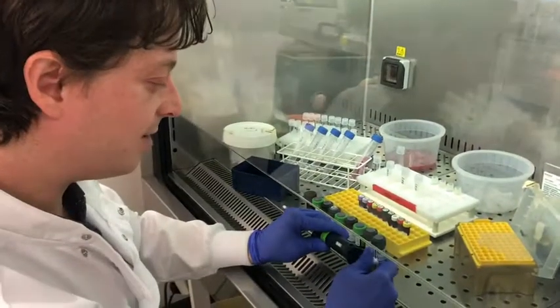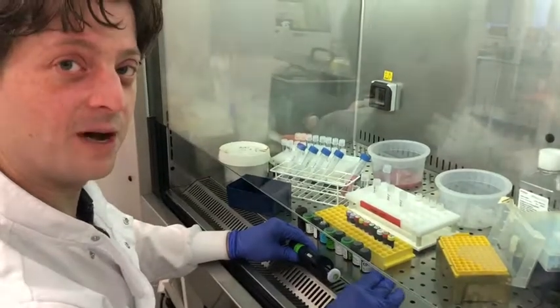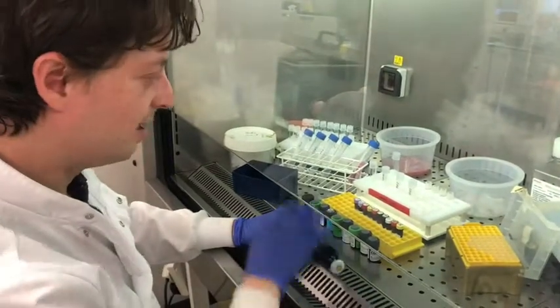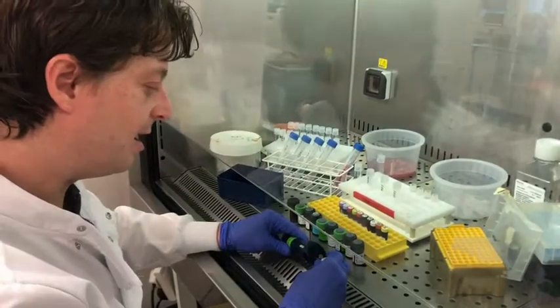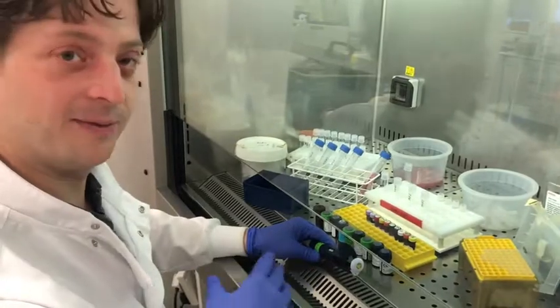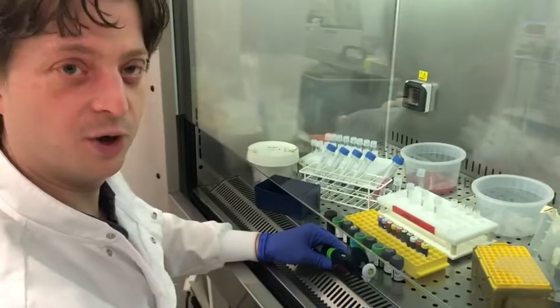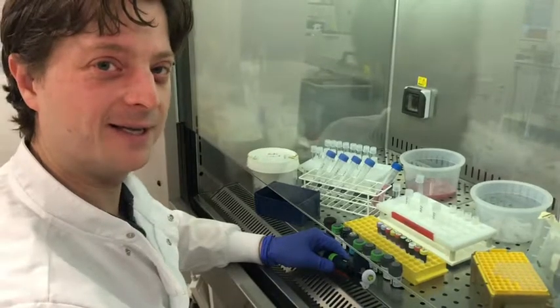Okay, so now each of these vials in front of me is specific for a different protein marker on the surface of cells, and they're all markers which could be relevant to the disease we're looking at. I'm looking at 4 different patient samples of an acute leukemia where after treatment for the leukemia, subtypes change. So an analogy might be if you culled all of one type of shark in the ocean, another shark might then take its place.